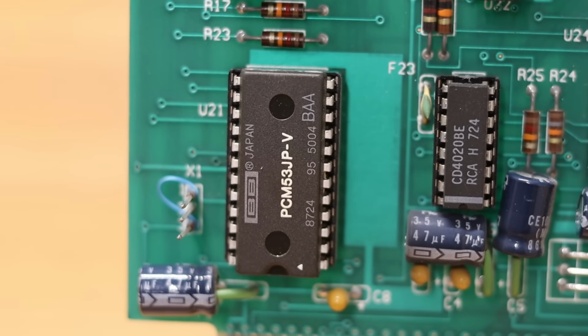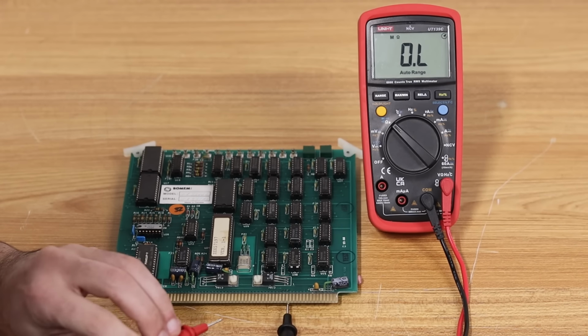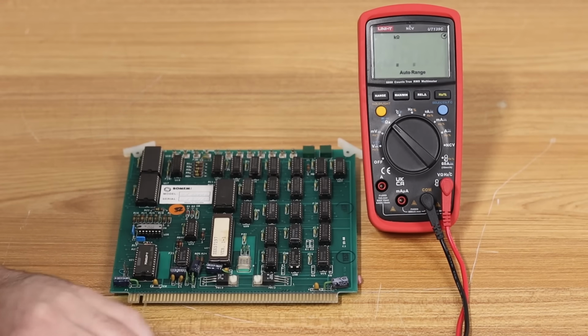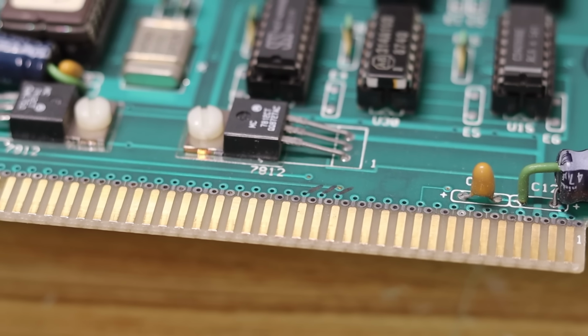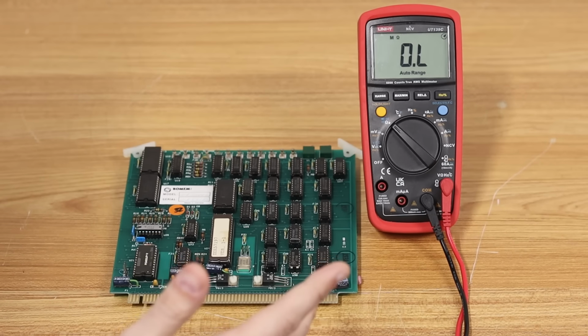But what I was most curious about was on these 3 pins right here. And check this out. If I put the probe on the back side and a probe on the front side, we can see 0.2 ohms. That pin is directly connected across. And it just so happens that these 3 right here are all directly connected across from the backside to the front side. And that is the plus and minus 15 volt rail with the plus minus 15 volt return.